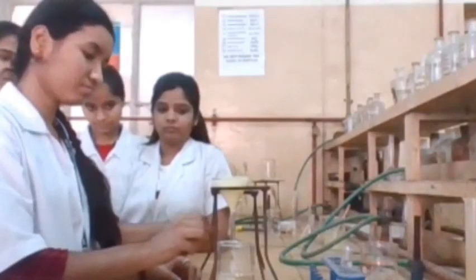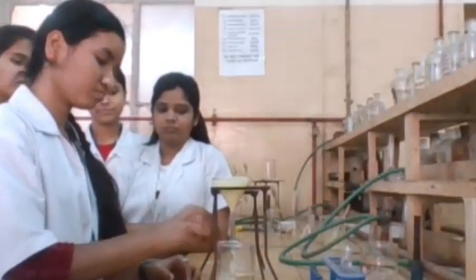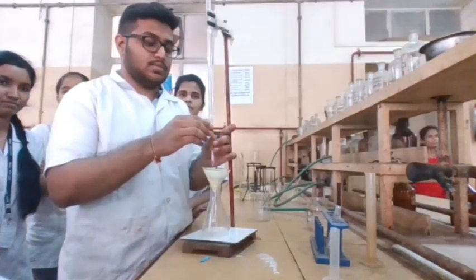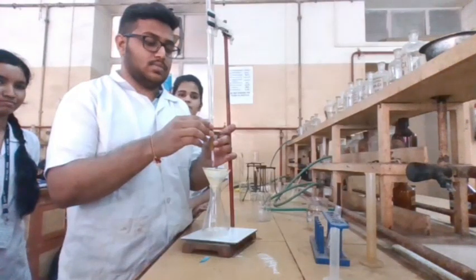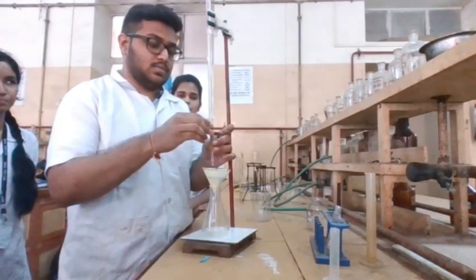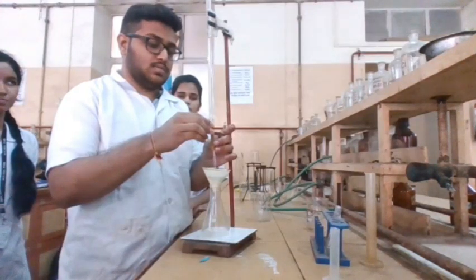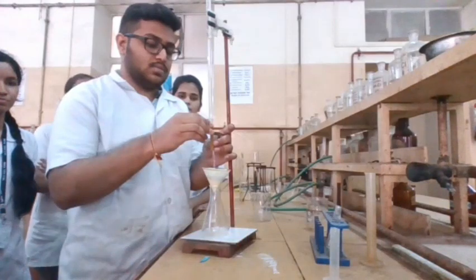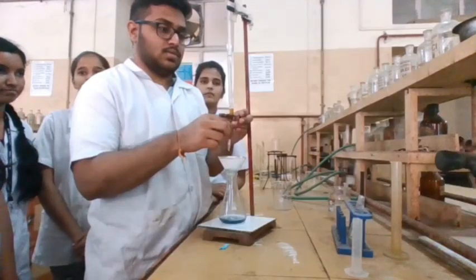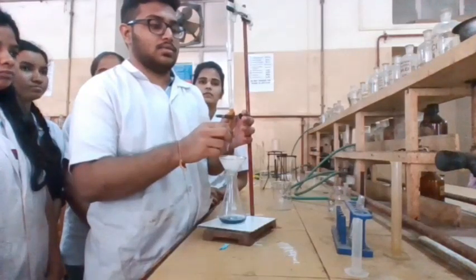Test with litmus paper — with the filtrate it should not turn red. Now dissolve the precipitate of ammonium molybdophosphate by dropwise addition of 1 normal NaOH onto the filter paper using a burette. Add 2 ml excess of 1 normal NaOH and note down the total amount of NaOH required for dissolution of the precipitate.